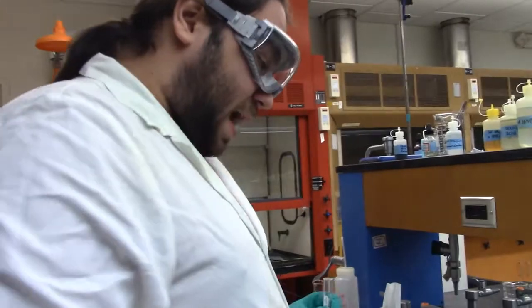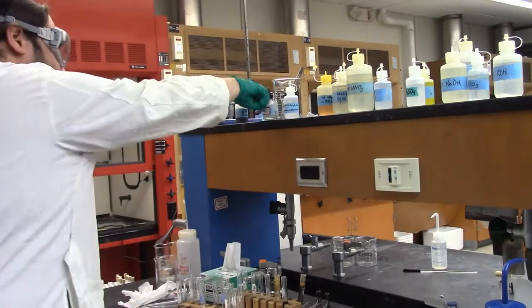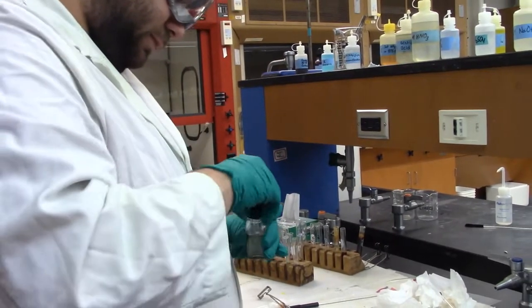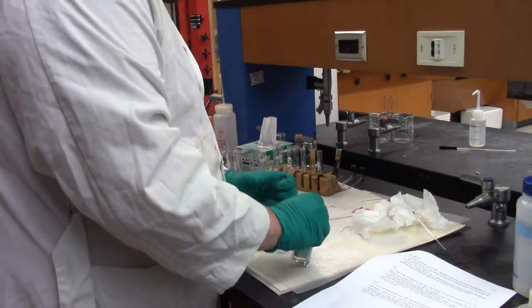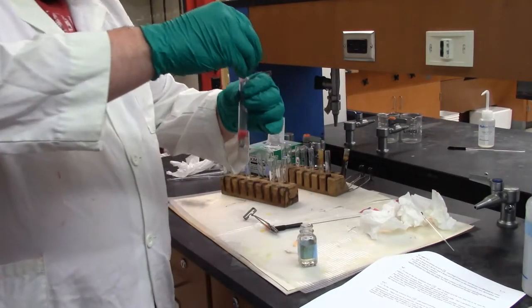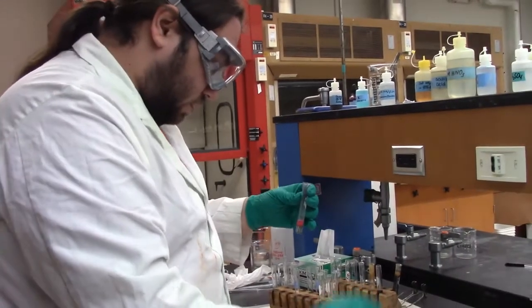So we're going to add some of our DMG reagent, which I should have found before I turned the camera on. DMG. This one. And we're going to see if anything funky happens. Oh, hello. It's stuck. Hopefully it didn't just destroy that. Oh, I did. Alright, so adding some of our DMG reagent, and got a nice pink color going there.